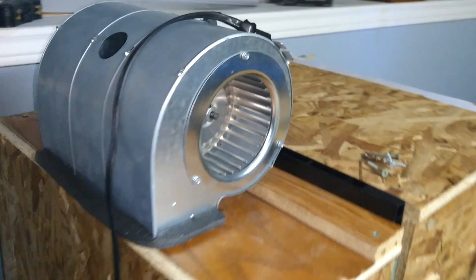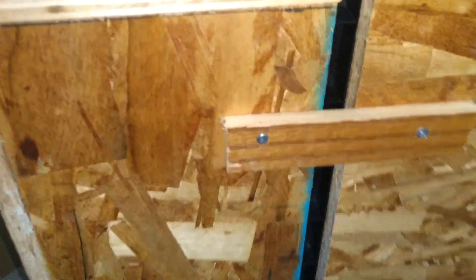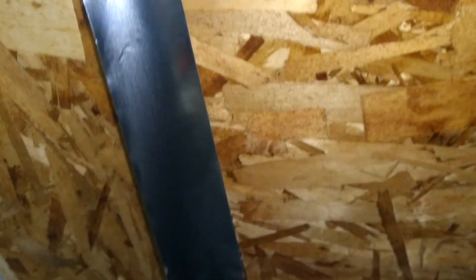That's the motor mounted on top. That's the plugged hole from the old position. Side brackets. Metal tape.